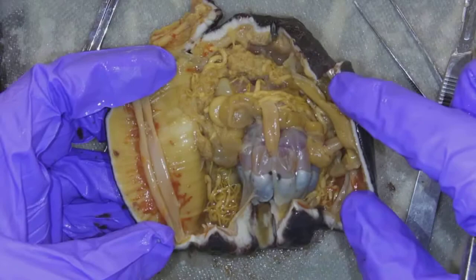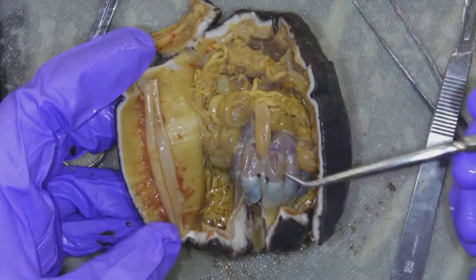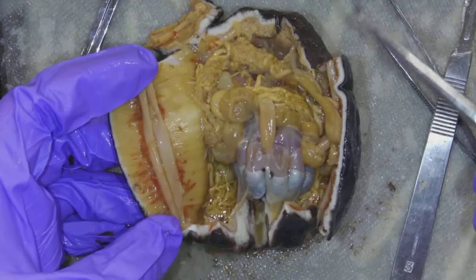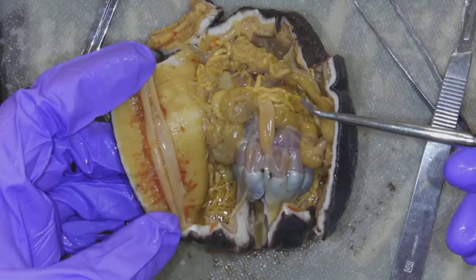Look at this beautiful creature — holy cow, it's so neat. For as bland as it is outside, it's as fascinating inside. He wanted to curl up quite a bit, so I had to cut him open — it wasn't a beautiful cut, but it works. It doesn't have an endoskeleton like the starfish or sea urchin does; it's a soft animal. You really do have to watch videos of this thing alive because the preserved specimen does it no justice, but we can see the internal structures.